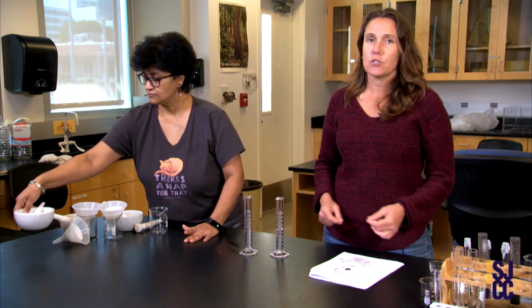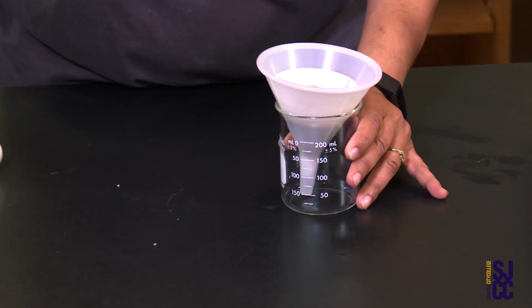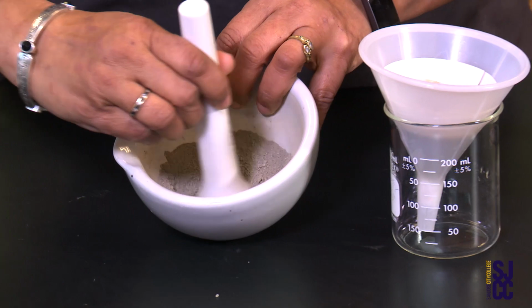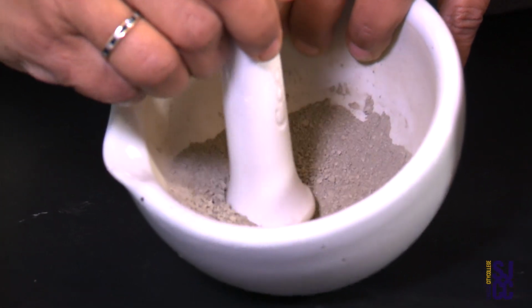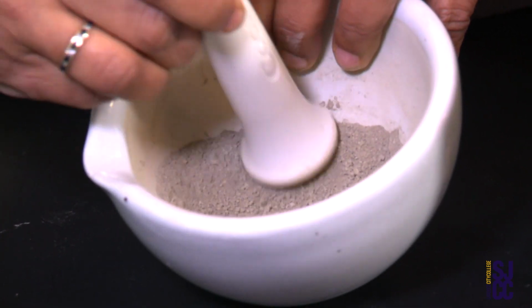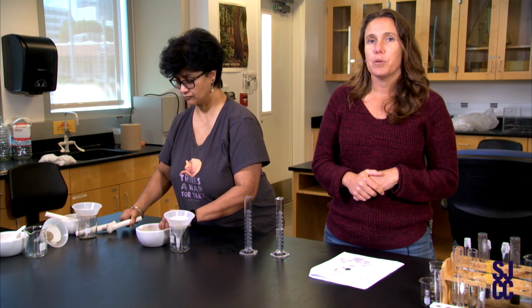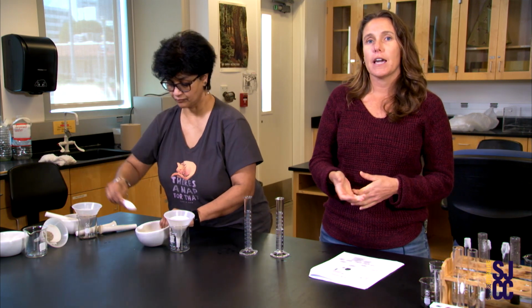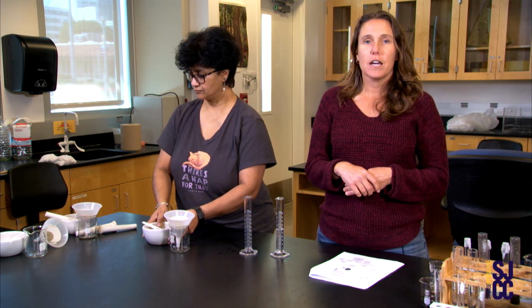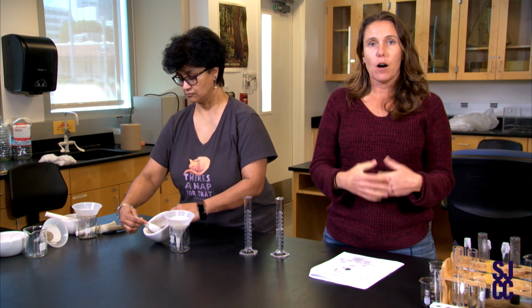And so the next one we're going to do is our clay, right? So our clay is actually a very, very small particle size, and oftentimes we use clay to build pots and pottery, and oftentimes clay can retain a lot of water, or hold it in. So again, we did the same procedure of looking at the clay particle size, putting in 2 tablespoons, using a mortar and pestle to keep it uniform. And again, we put this in our funnel with our cotton ball. And again, we put 30 milliliters of water onto these 2 tablespoons of the clay.